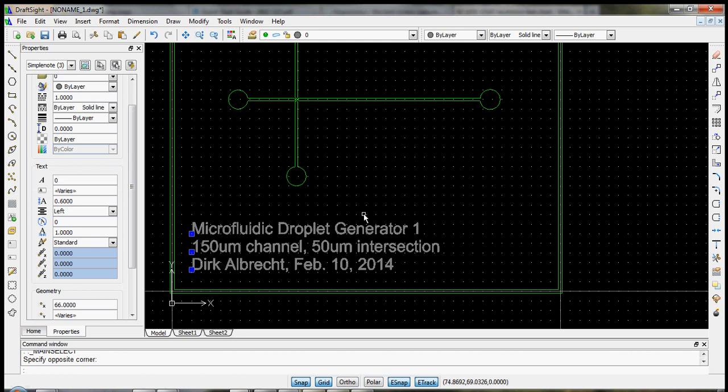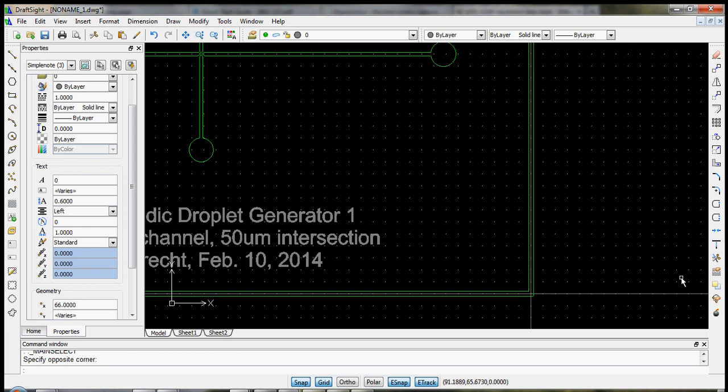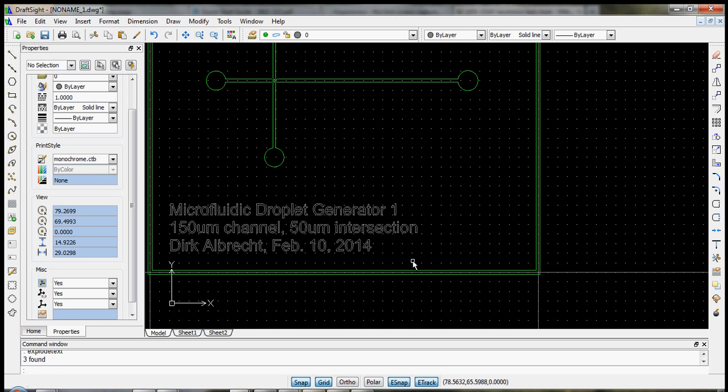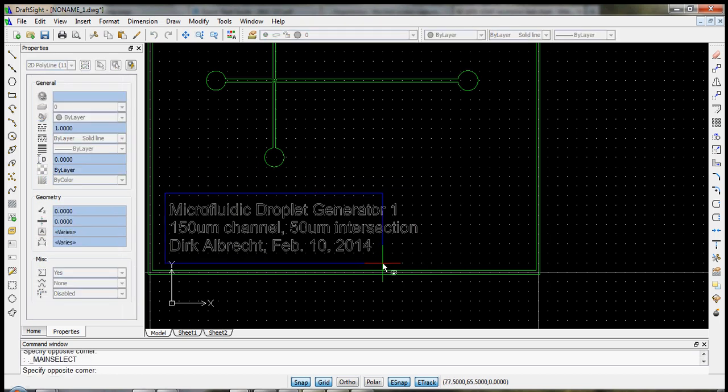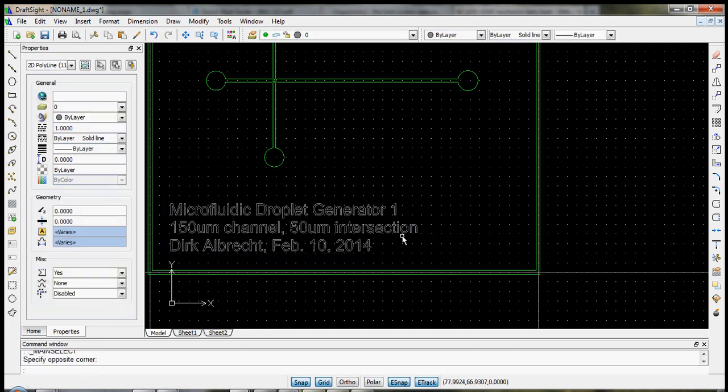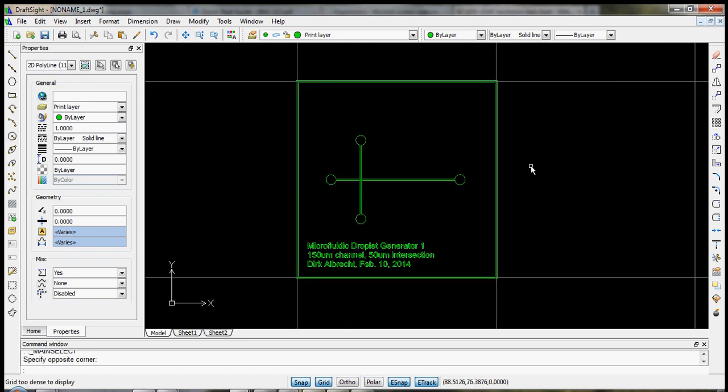Okay. Now, we want to then, again, have closed polylines. These are simple note elements. We need to convert them. And one way to do that is to type a command called explode text. Okay, now we have a bunch of elements. And let's bring them to the print layer. And as you see, they're now 2D polylines. And they're closed. So these are good. So here's our first microfluidic device.